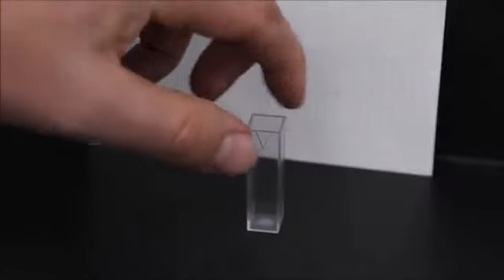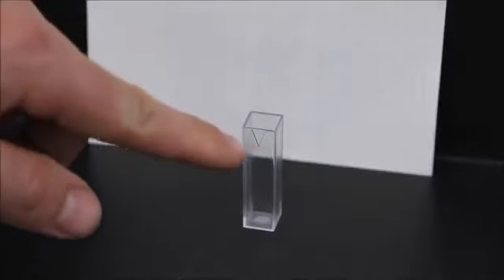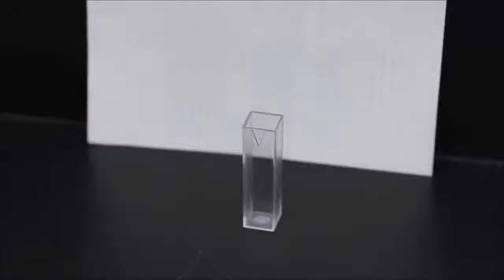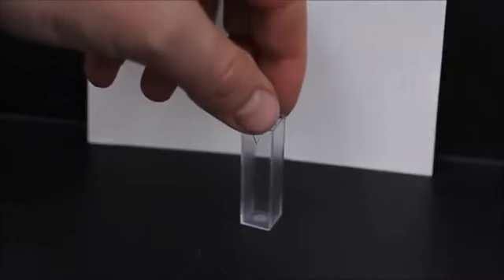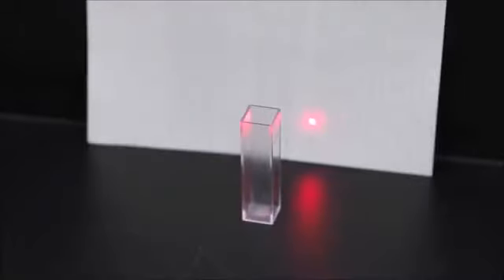If the cuvette is oriented such that the triangle in the cuvette is facing right in the cuvette holder, then the path the light beam travels is through the non-frosted sides and is largely unaffected. However, if the cuvette is turned 90 degrees from the correct orientation, then the path of the light beam is through the frosted sides and is noticeably and significantly affected, resulting in inaccurate measurements.